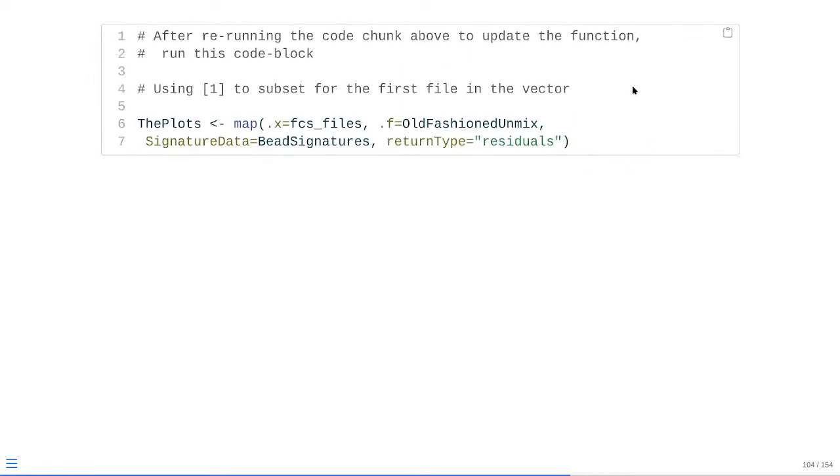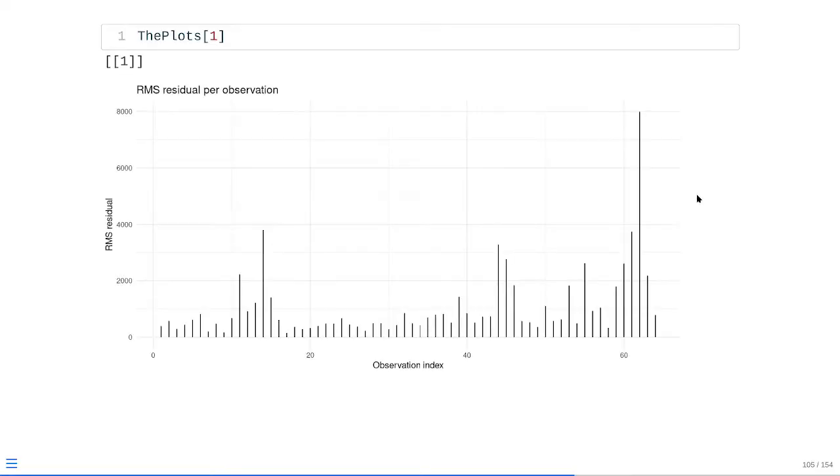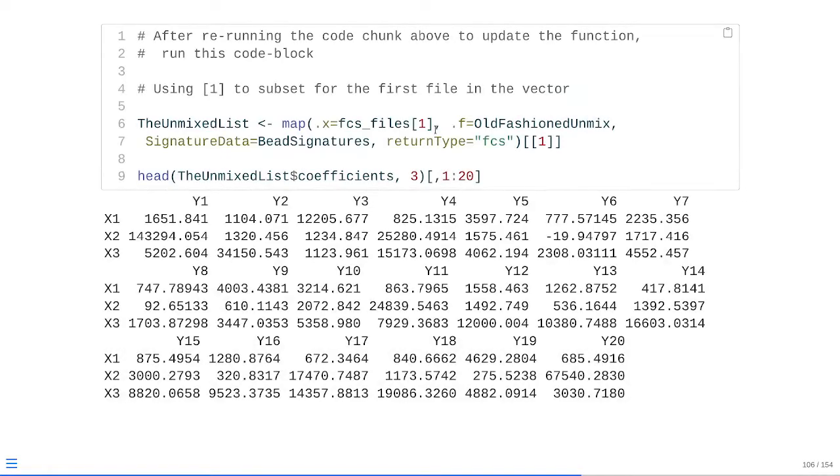Sure enough, at that point, we refresh our function so it's active in our local environment with the correct new arguments. And then at that point, if we try the return type is equal to residuals and run it, you see we get back our little residual plot. Vice versa, if we run it with FCS as a return type argument, we get back the values that we expect for our unmixed FCS file.